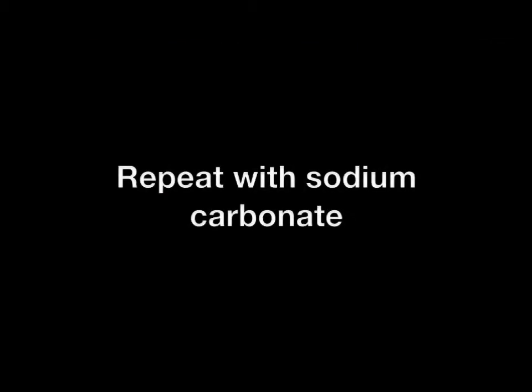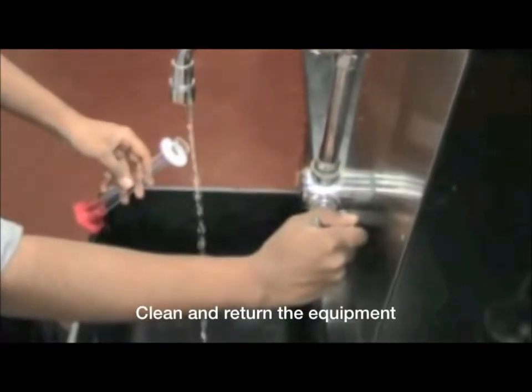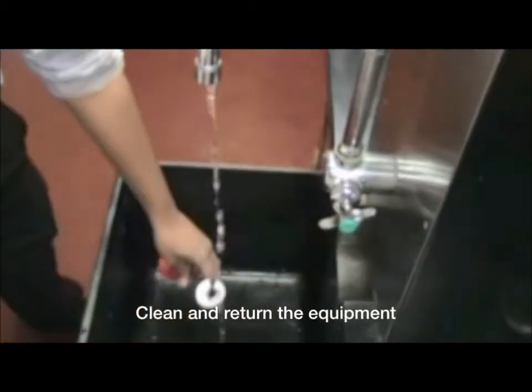Repeat the procedure with sodium carbonate this time instead of sodium bicarbonate. Finally, clean all the equipment and make sure to return it to the desk.